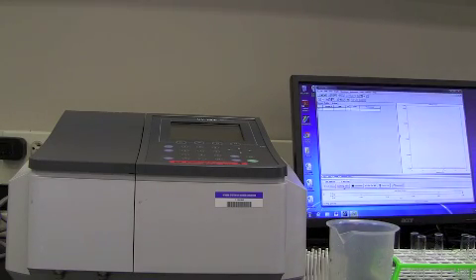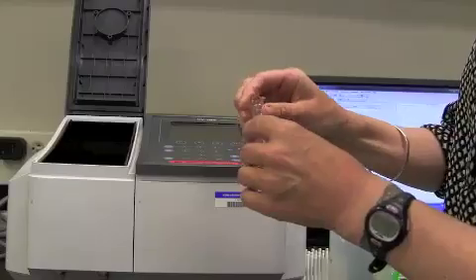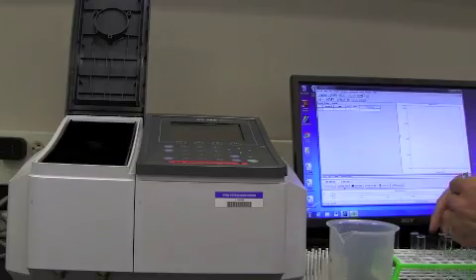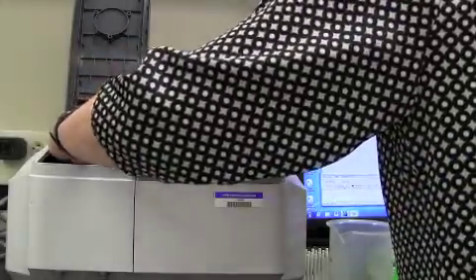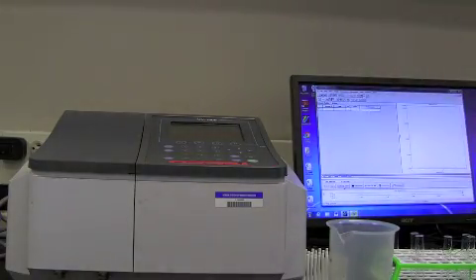So I'm going to write that down. I'm going to keep doing this. So pour that out. Pick up our second, our 20 mg% duplicate. Close the lid. Look at the absorbance. Okay, that's 0.391.